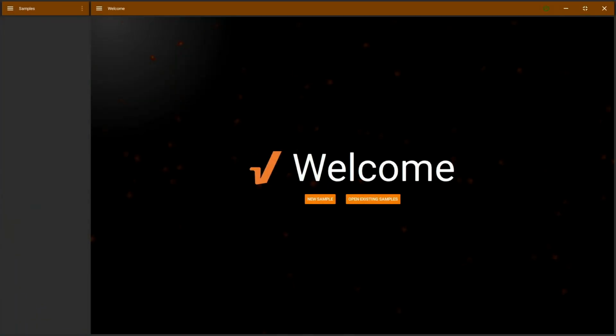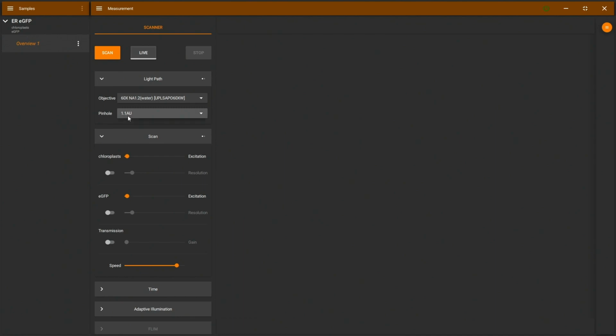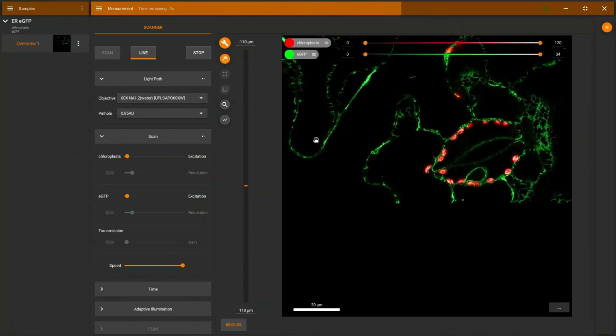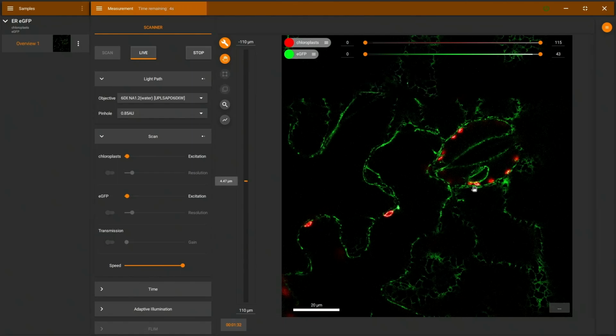Here we are back in the software. I will create a new sample with eGFP and chloroplasts again. Name this ER eGFP and go to a new overview and clean up the menus here a little bit and close the pinhole a bit further. And then I go to the slider here to get a little bit more speed, and then we will create a live overview. Here we go. And overlaying both, we can see here a stoma with lots of chloroplasts, and then areas around this with fewer chloroplasts. And I can use my mouse wheel again to refocus here.